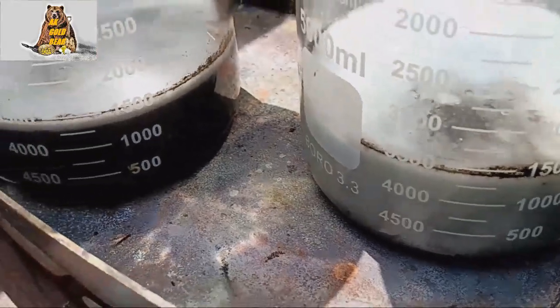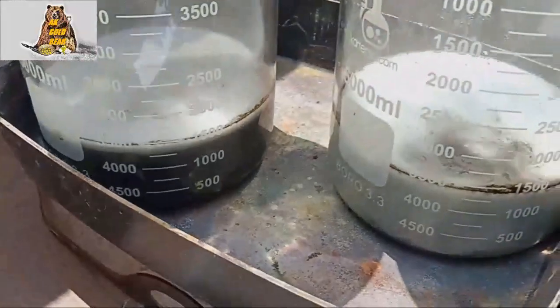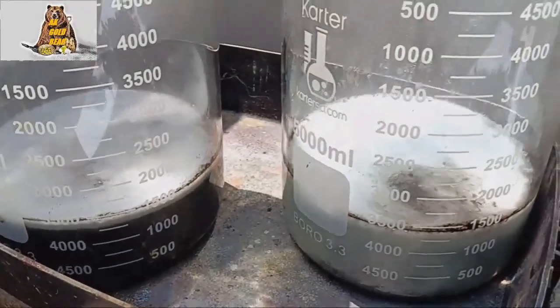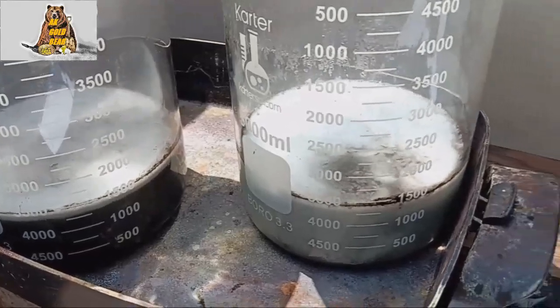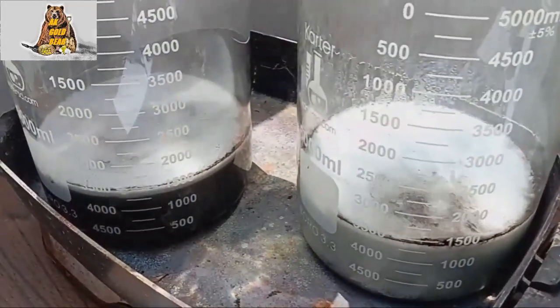Reaction very strong. Guys, I do not use heat right now, it's off, because solution too hot right now. Just in case I recommend you to keep extra water near, because sometimes reaction too strong.